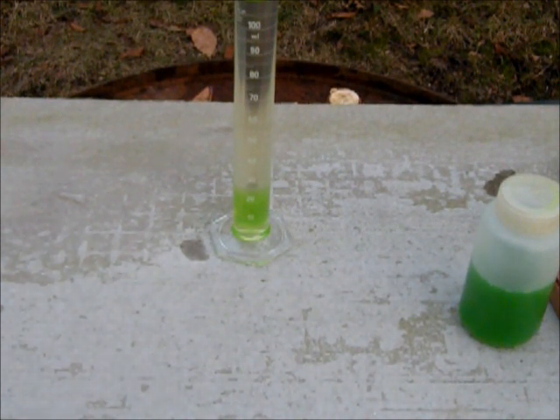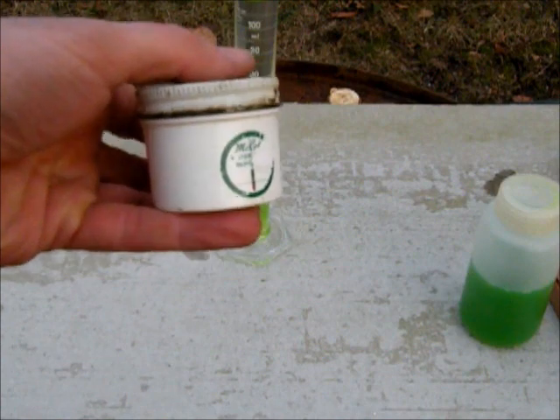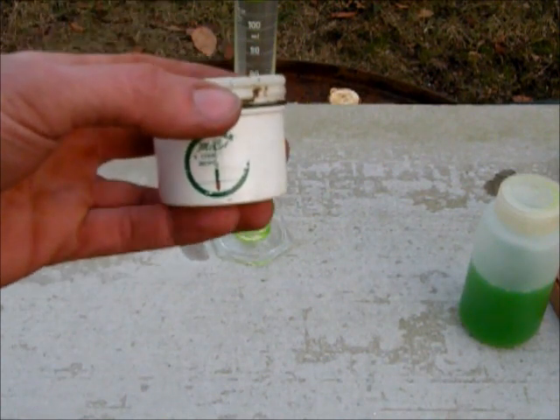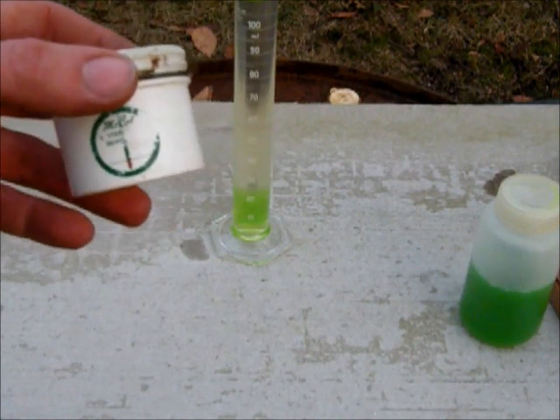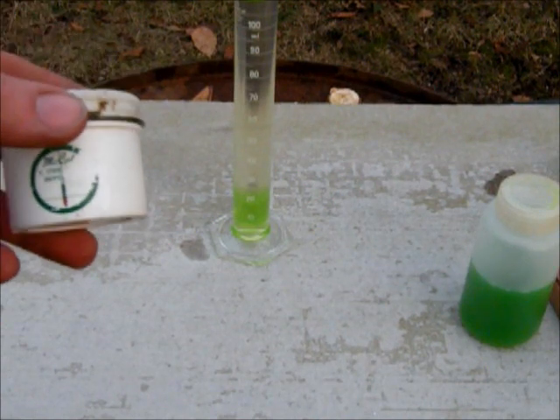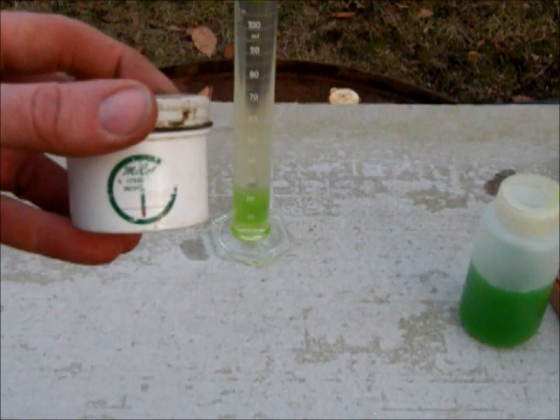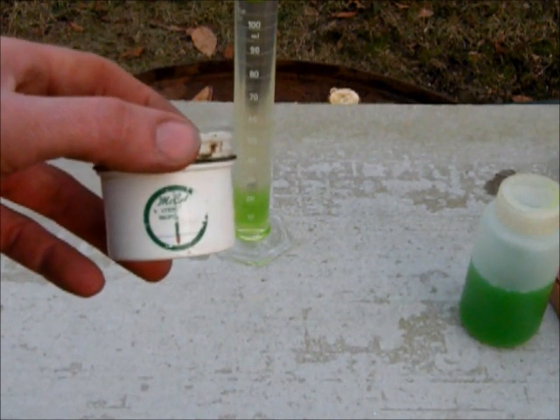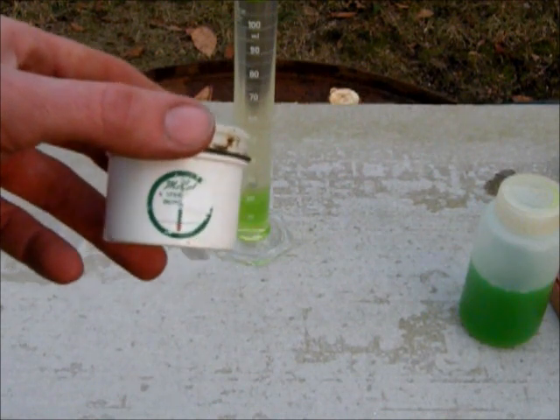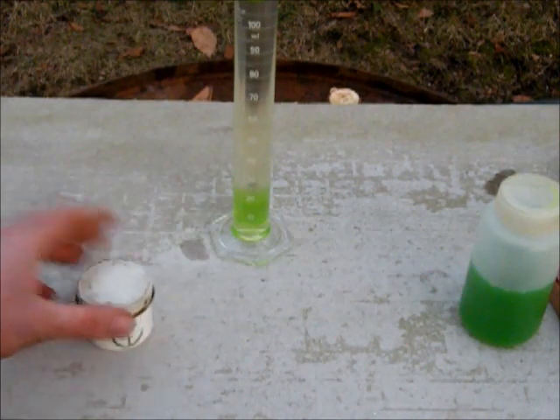I have another thing to show while I have it here. Dad used to have to use this stuff right here to stick the underground tanks and check to see if there was any water in the bottom of the fuel tanks at gas stations and so on. Because of condensation and being underground, you're going to ultimately end up with some moisture in the tanks. There's a certain amount that's allowed and an amount that is not allowed, so they have to stick the tanks and check. I'll demonstrate it here in a second — I'm going to get a cup of water.